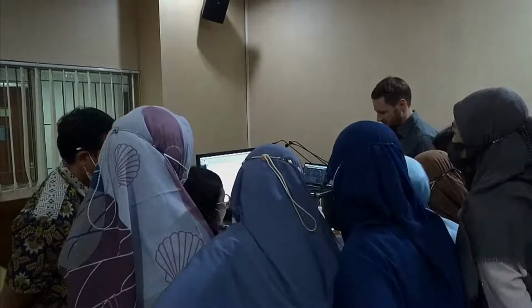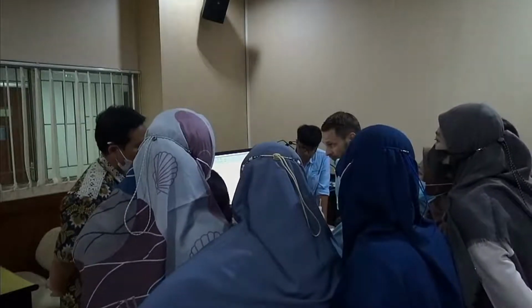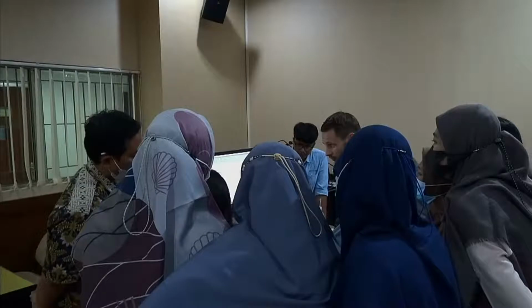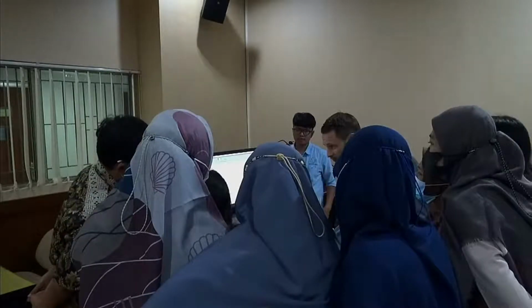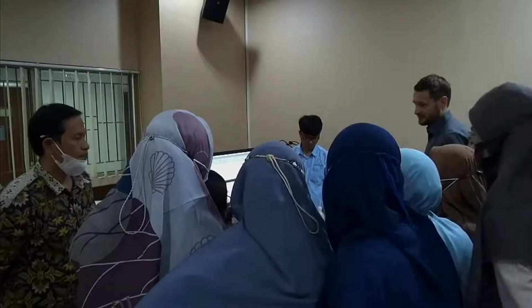Sometimes I tend to forget because I talk so much, but I try to remember putting fresh water after the measurement. So the first thing we do, we make ourselves a new folder. We don't want the old folder from the other group. We want an empty one. So we do it just like that. And of course, it's empty, no measurements inside.